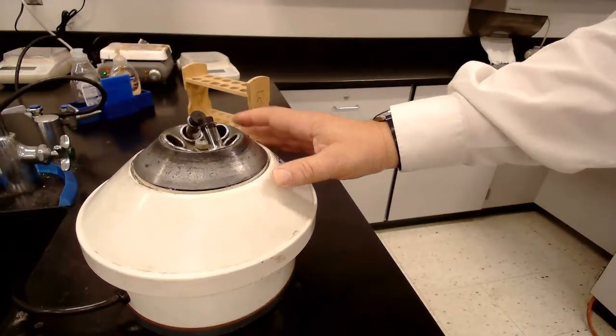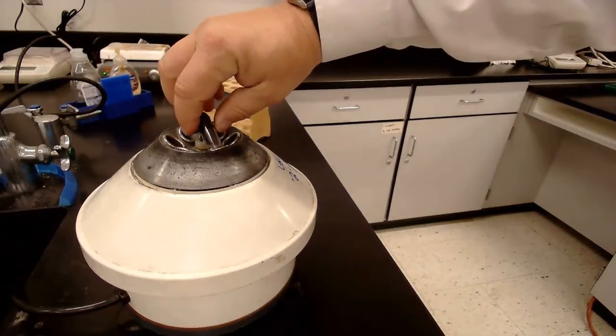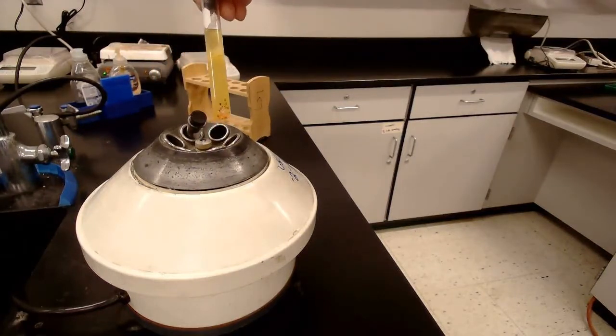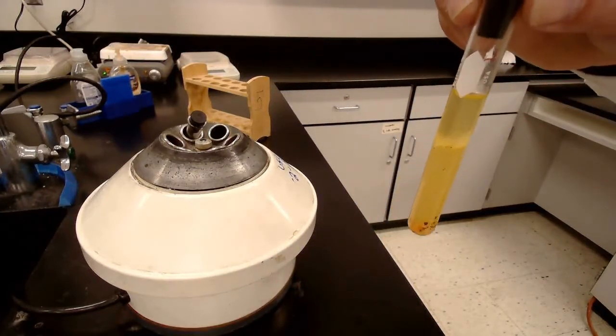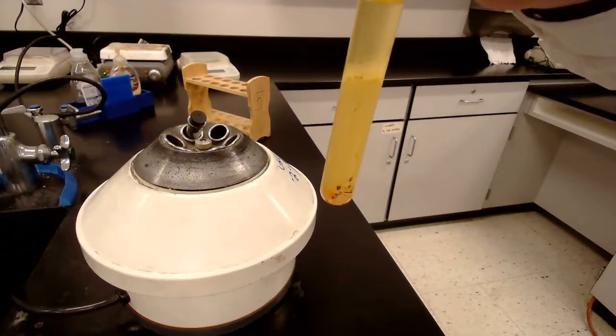Now, let's take a look and let's see if we can see a difference from what we saw before. Now, what you're going to do is you're going to draw this in the after part.